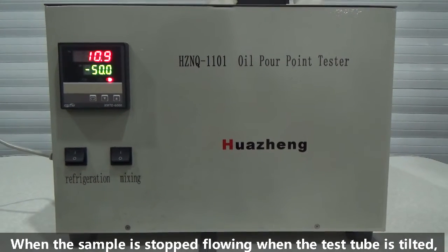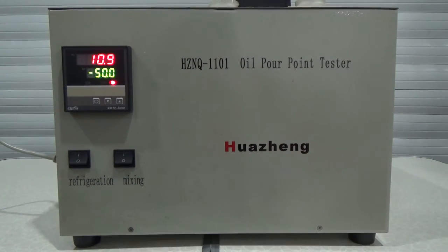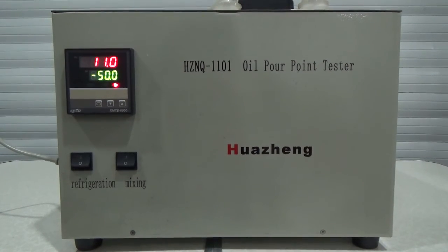Continue until you reach the pour point of the sample.